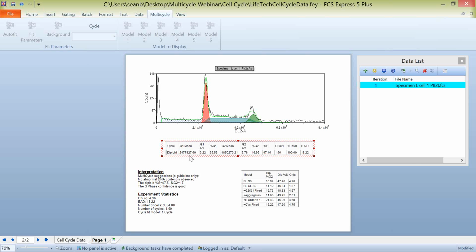You're going to have the value for your G1 and G2 means. You're going to have your percentages for G1, S, and G2, as well as the ratio that was used here. So again, this is the G2 to G1 ratio. In theory, this should be 2. Our mathematical model is determining it's a little under 2, which isn't so bad. So these statistics will be here as you navigate between different data files that you've put in your data list. They, of course, will update for you in real time.